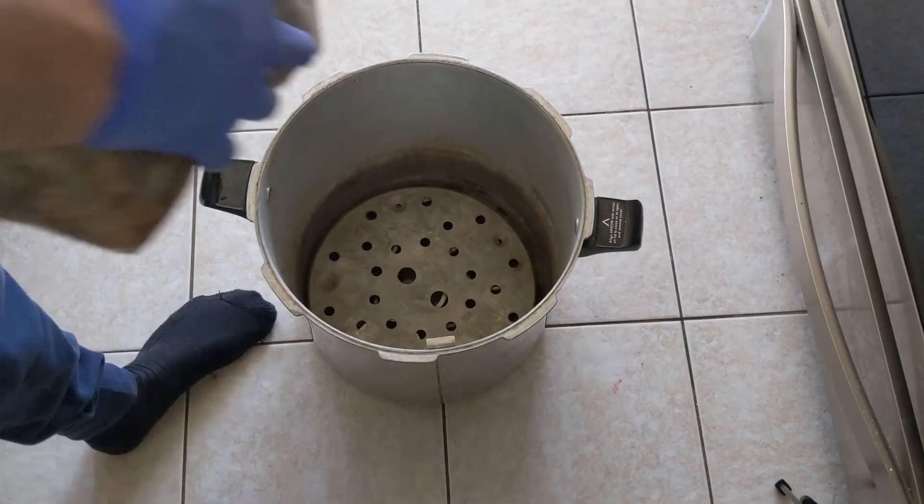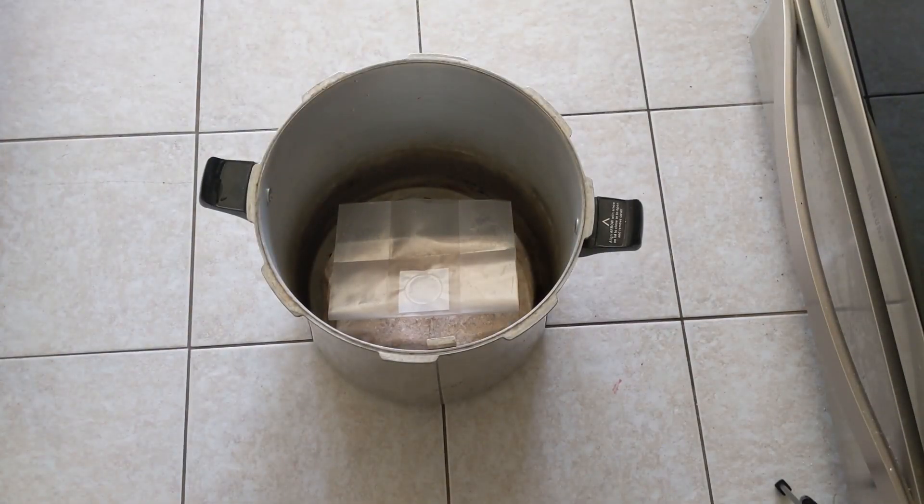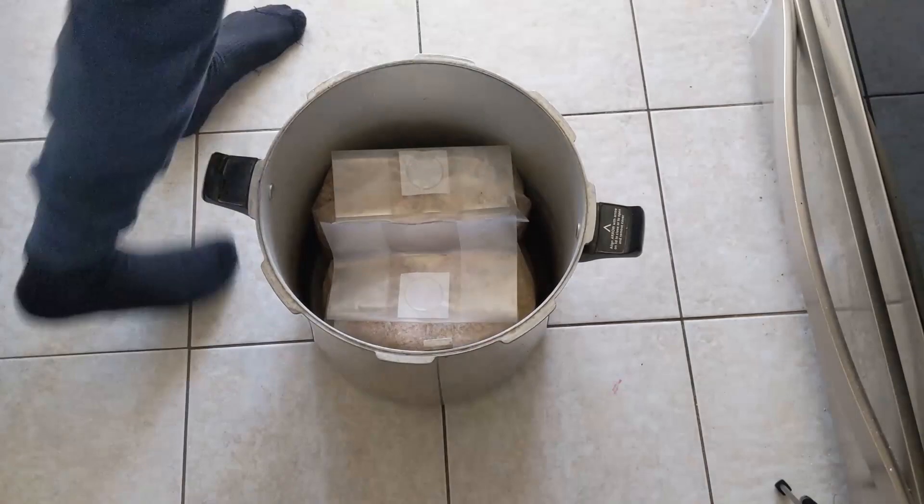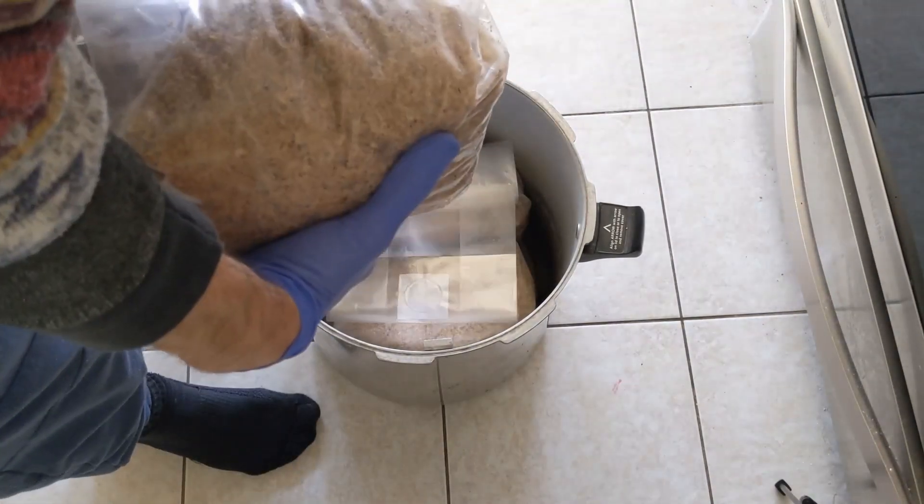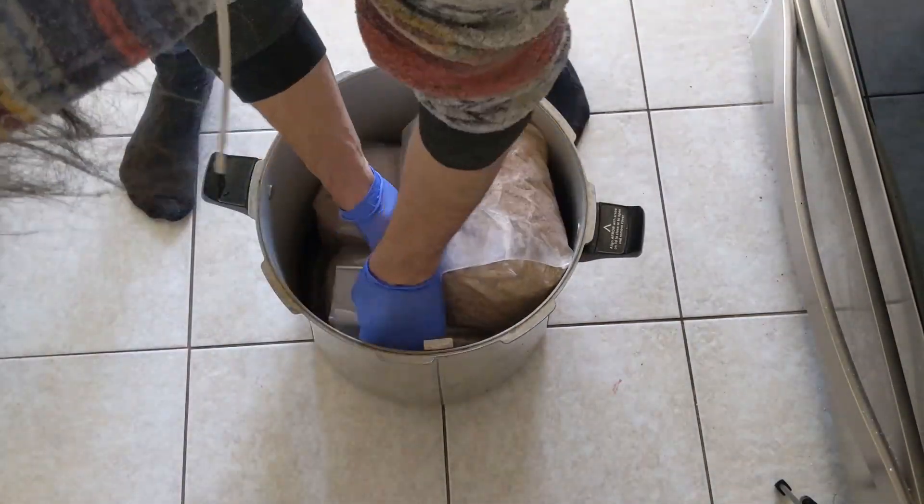Okay, so for loading up again, horizontal in the bottom bags. Do not worry too much about the flaps opening because when we add the top blocks, it's going to kind of secure everything. Next step is going to be pressure cooking.